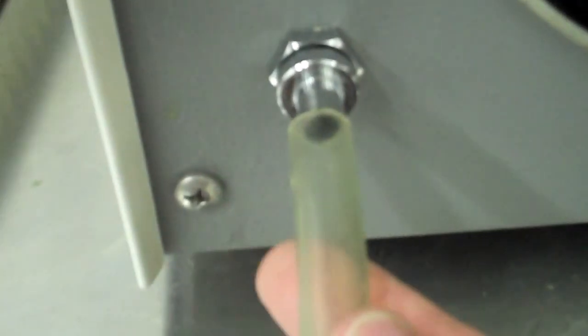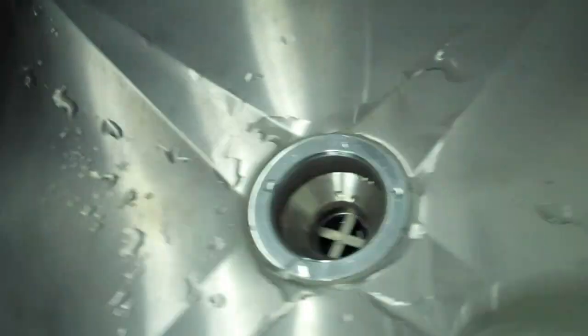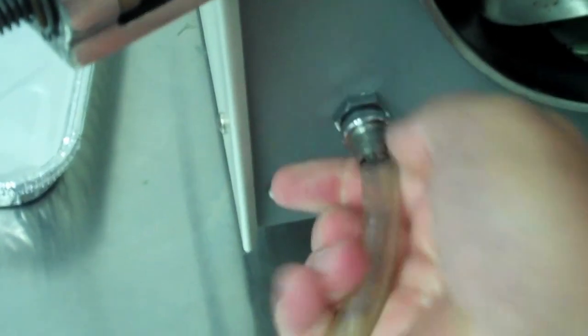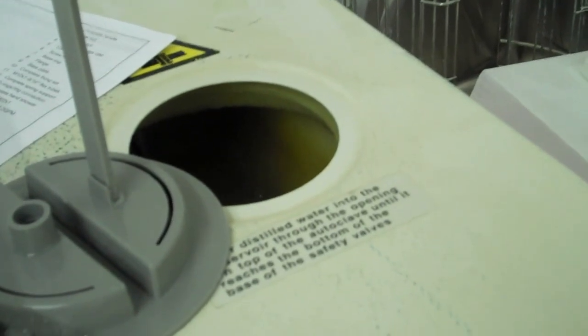If I place the tube on there, this is actually a valve and I'm running the tube down into the sink. To drain the tank, I spin it counterclockwise and water, as you can see, there's water coming through there. You see that? The water is coming through. That is actually physically draining this tank.